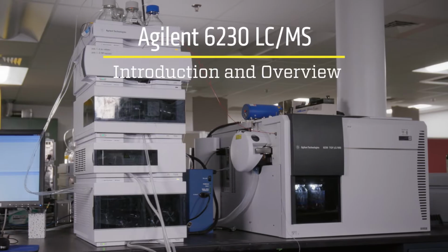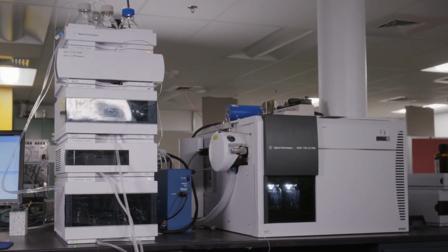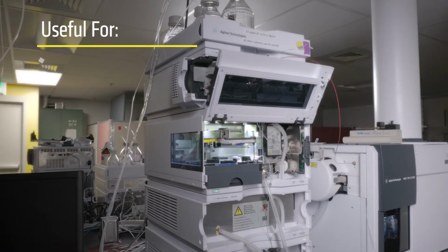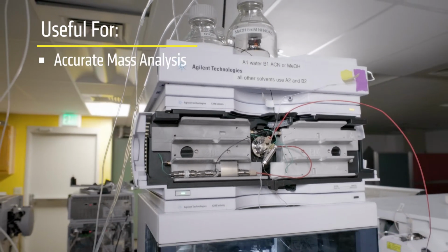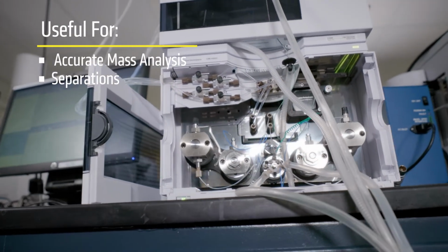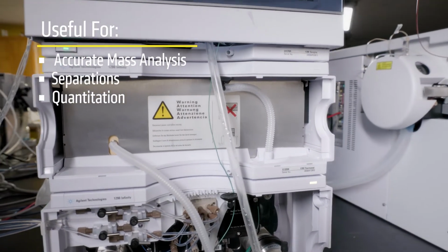The Agilent 6230 LC-MS is an open-access instrument in the Materials and Molecular Analysis Center at the Analytical Resources Core. Using this system, you can accurately identify the molecular weights of compounds in a sample. If your sample is a mixture, the liquid chromatography system can be utilized to efficiently separate the components of the mixture prior to mass analysis. Quantitation of an analyte is also possible with this system.